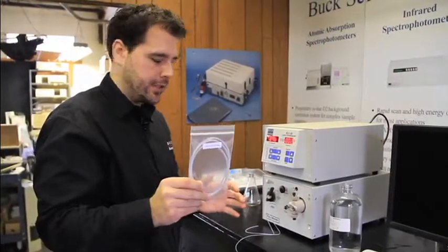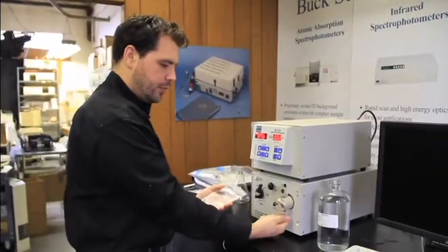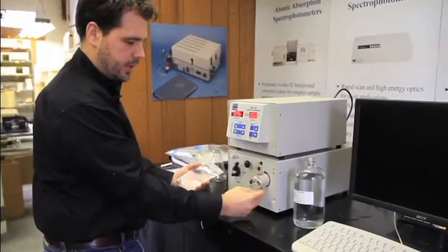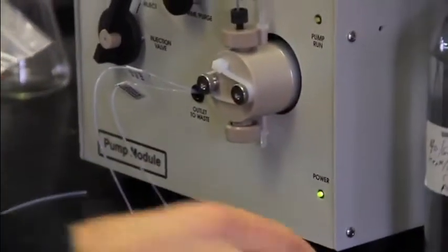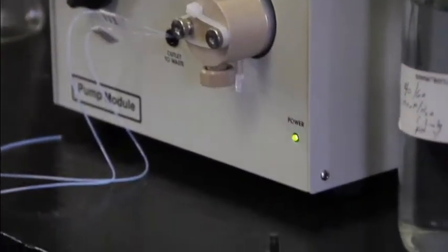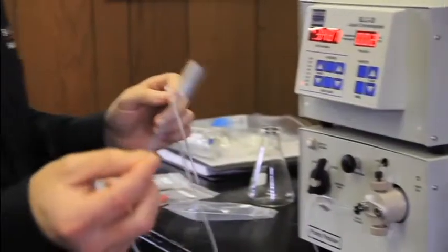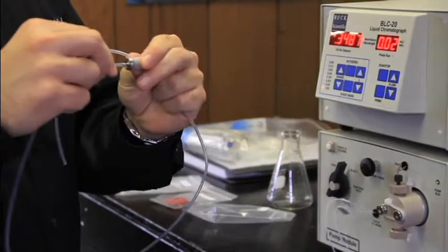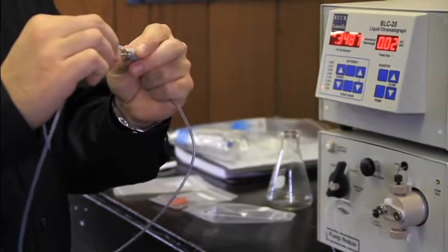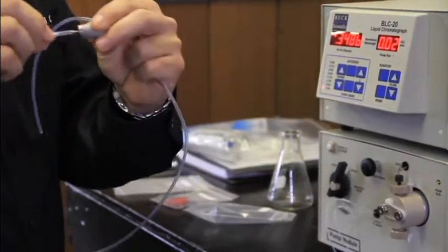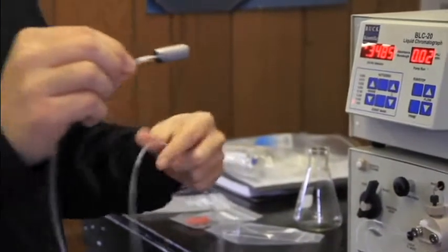The first step in connecting the tubing is to take the solvent delivery tubing. Remove the plug from the bottom of the BLC 20 pump. You should set that aside and save it for later in case you need to store it. The tubing should already come with the solvent inlet frit attached. If it's a little bit loose, just push the tubing back on the connector.